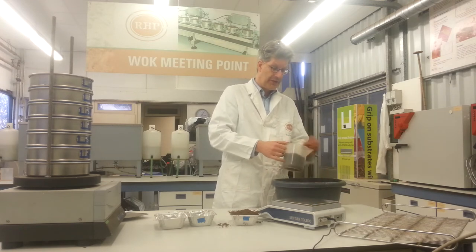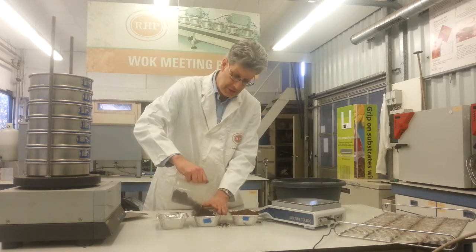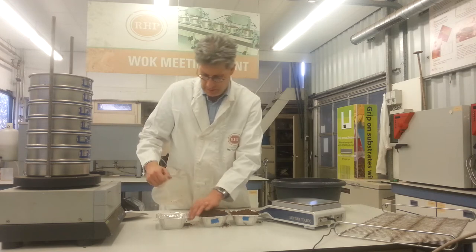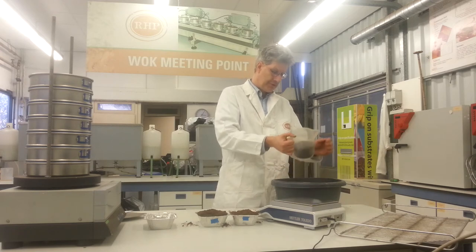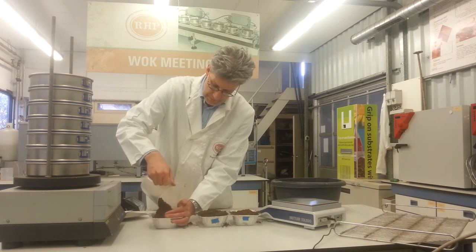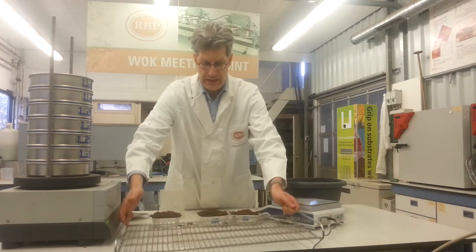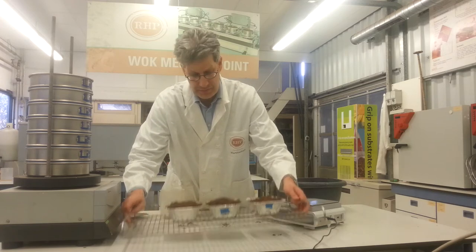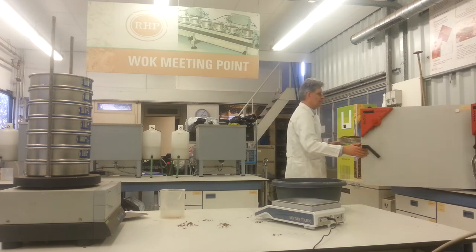I also can fill these troughs to the brim in principle. The tray should be in there of course. So we fill these troughs to the top level. These are placed on a tray and they go in the stove for, as I said before, 72 hours, minimum 48 hours, drying at 40 degrees centigrade in this air-forced stove.